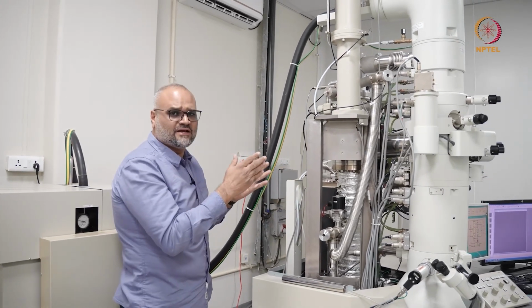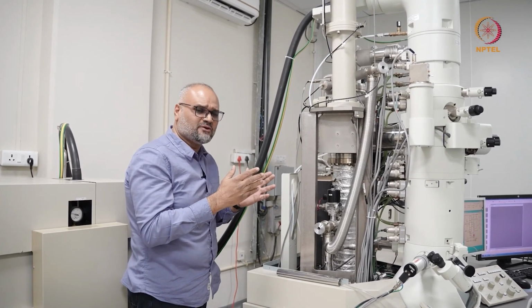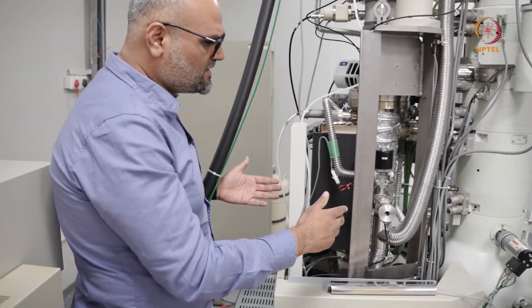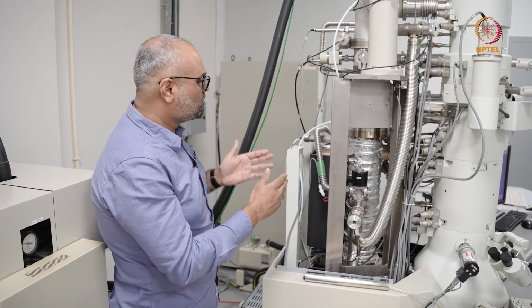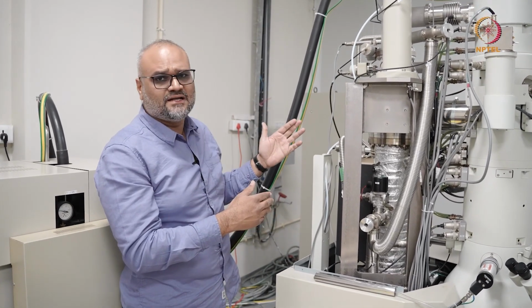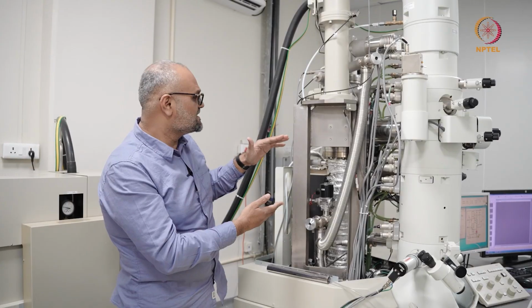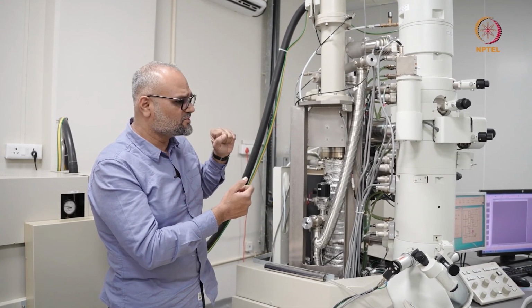The vacuum system of the microscope, as informed, runs under ultra high vacuum, and to obtain basic vacuum all through, you have a few roughing pumps in the background here. The roughing pump is connected to the oil diffusion pump. In some cases, you may have a turbomolecular pump, and once you achieve about 10 to the minus 3 or 10 to the minus 4 millibar, your oil diffusion pump starts on, and once you steadily achieve a vacuum of around 10 to the minus 5 millibar, that is when your sputter ion pump takes over, and that is how you achieve ultra high vacuum in a microscope column.